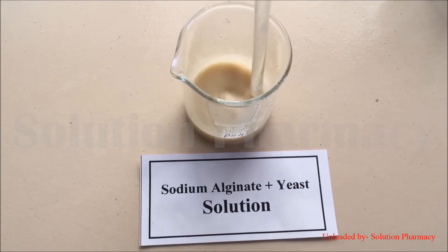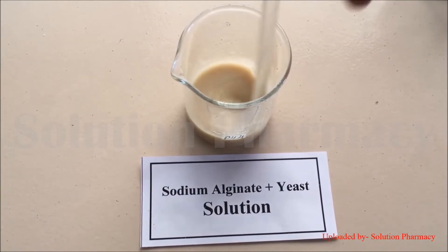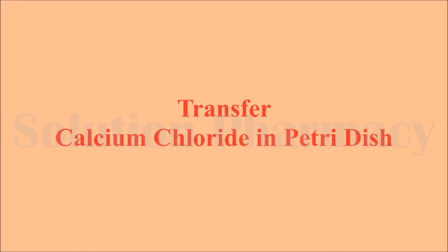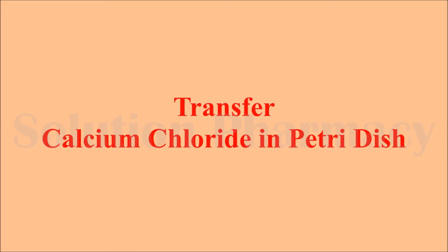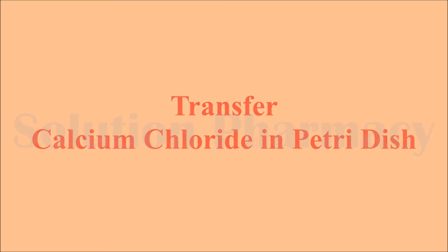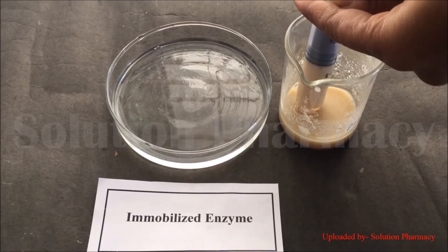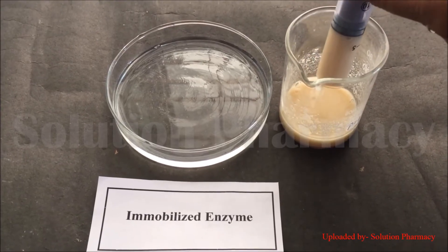Add the yeast suspension into the sodium alginate solution in a beaker, then mix it properly with a glass rod. After this, transfer the prepared calcium chloride solution into a petri dish — you can also use a small beaker.